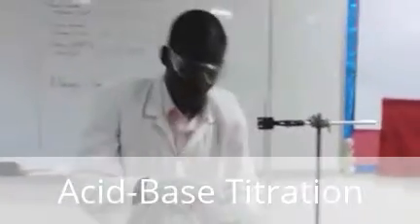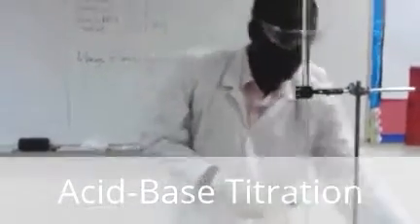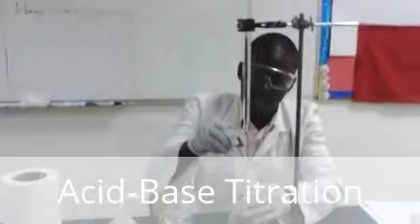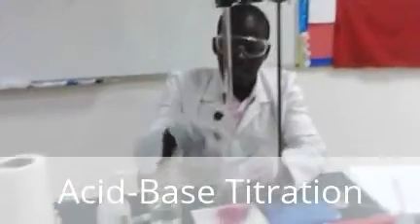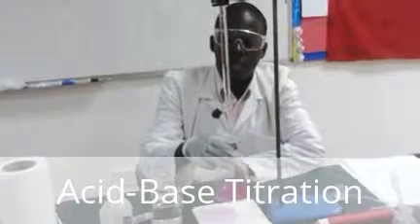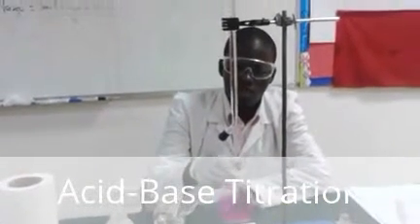Then I add 2-3 drops. So 1, 2, 3 drops of phenolphthalein indicator. Then I titrate. I open the tap again. I titrate until I see a color change.